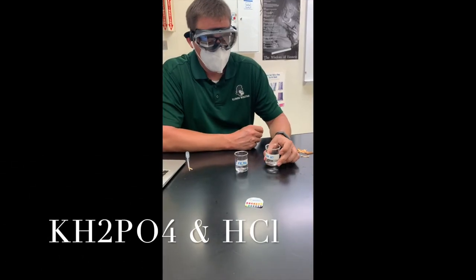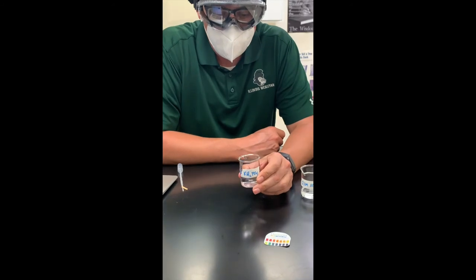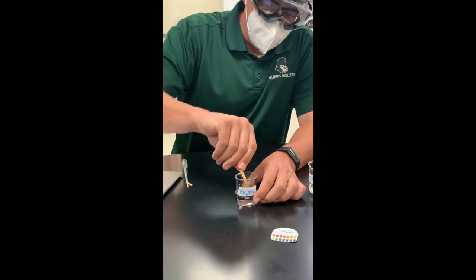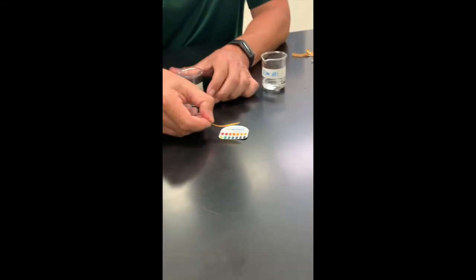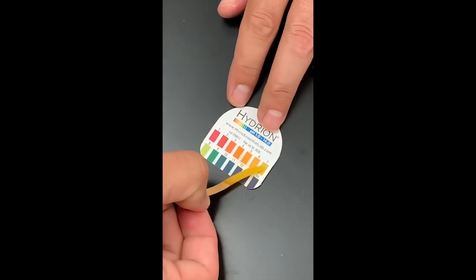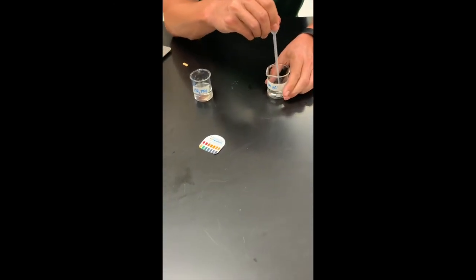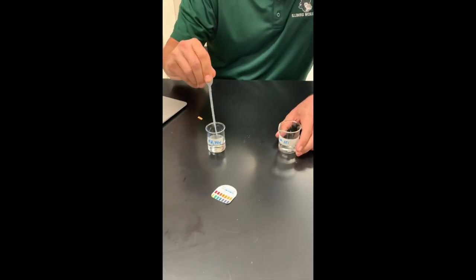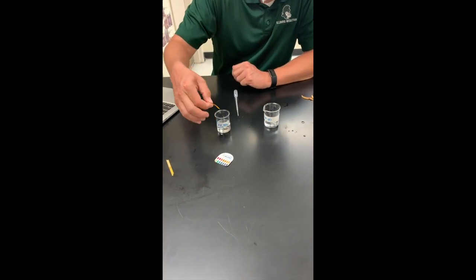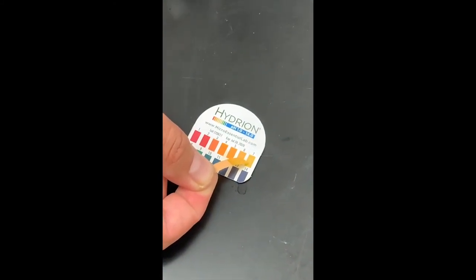The last experiment we're going to do is testing the effects of 0.1 molar hydrochloric acid — adding it to our potassium dihydrogen phosphate buffer and testing the effects on the pH after we do that. First, we need to make sure we take the pH of our buffer. It appears to be starting again at about six and a half, kind of between six and seven. So this time we're going to add a milliliter of hydrochloric acid at a time. After the first milliliter, it doesn't appear to be any different — still sitting right around that six and a half mark.